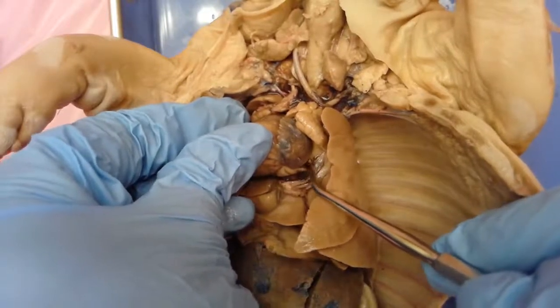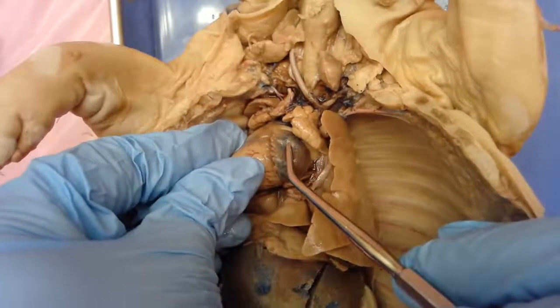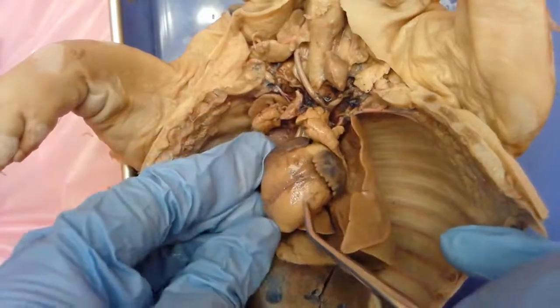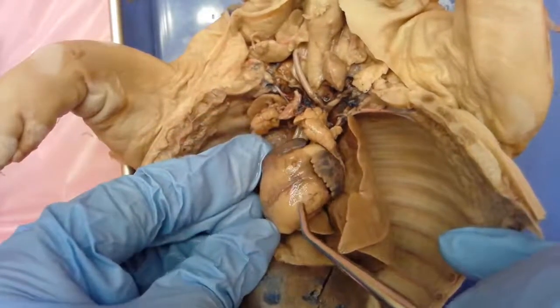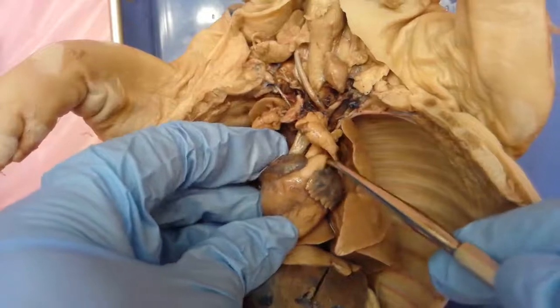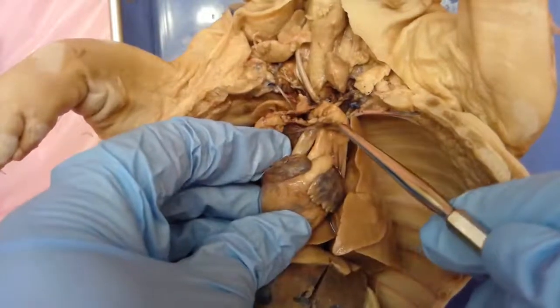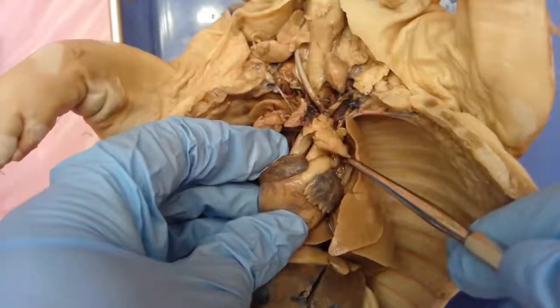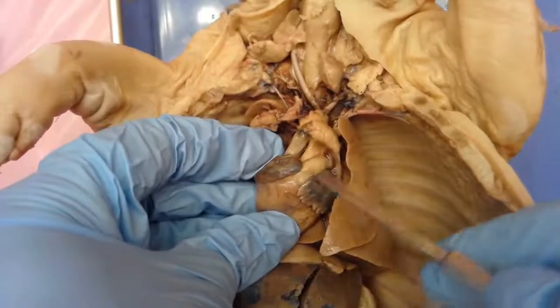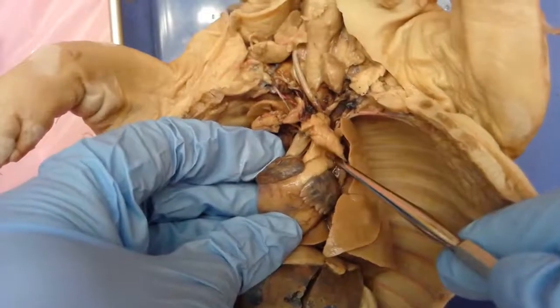From the lungs, now this oxygenated blood is going to enter back into the left atrium through these pulmonary veins. Now you have the left atrium sending it to the left ventricle, and that left ventricle is sending it to the aorta. And the aorta is going to send it to the upper and lower body. The aorta is here, and the pulmonary artery is at that angle kind of going on top of it.